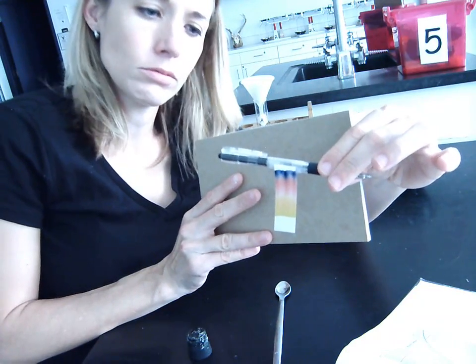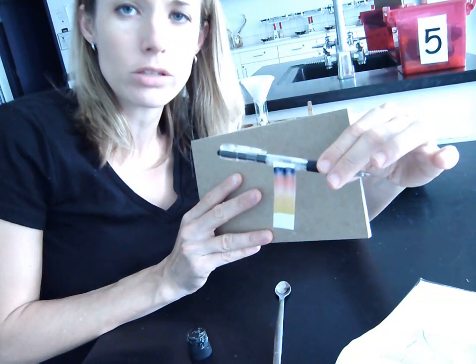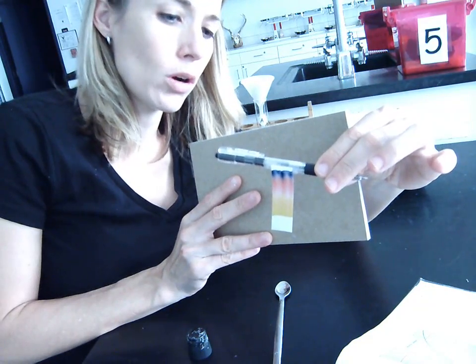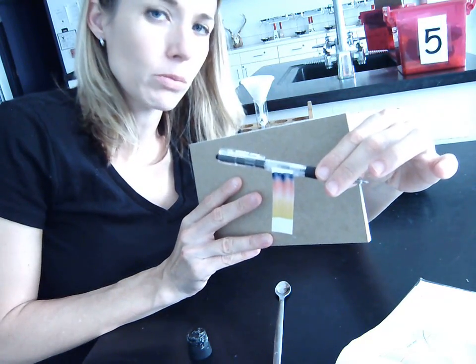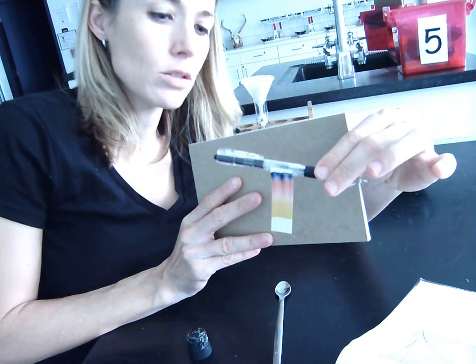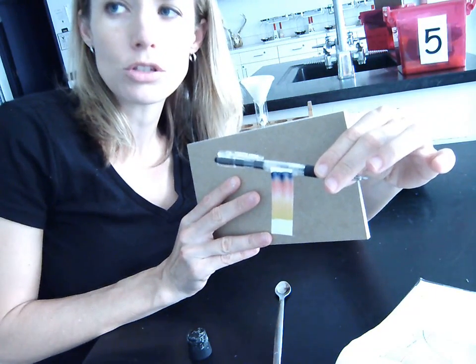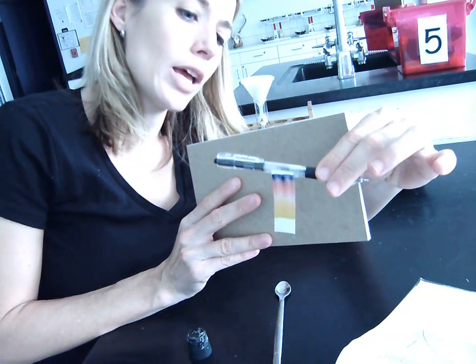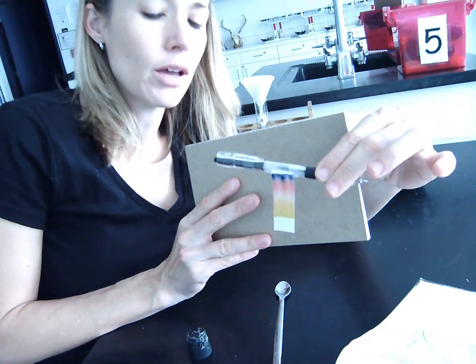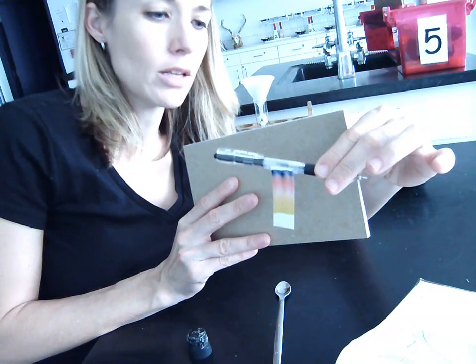There's the black ink when we separate it out. So if you remember from the beginning, there was a line of black ink across the bottom of the paper. We put the edge of the paper into some water. The paper pulls the water up. Again, you have to have special paper. It doesn't work with any paper. So the paper pulls the water up through the black ink, and as the water moves through the black ink, it separates the black ink into its individual colors. So you can very easily see yellow and red and a bluish purplish at the top there. And that is another method of separating mixtures. It's called paper chromatography. And that is lab 5.6.